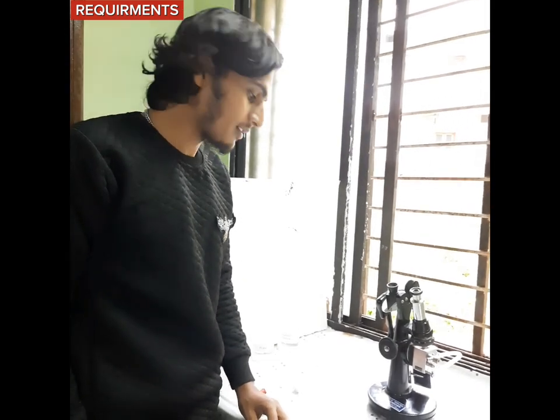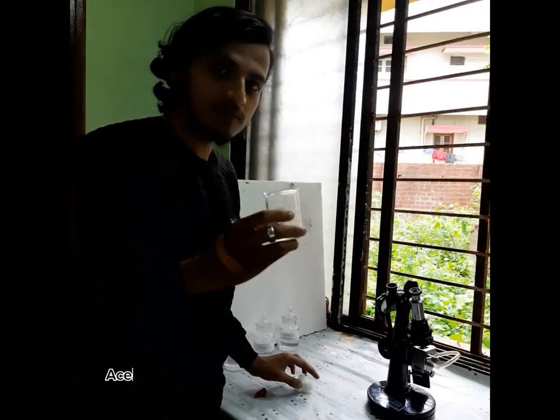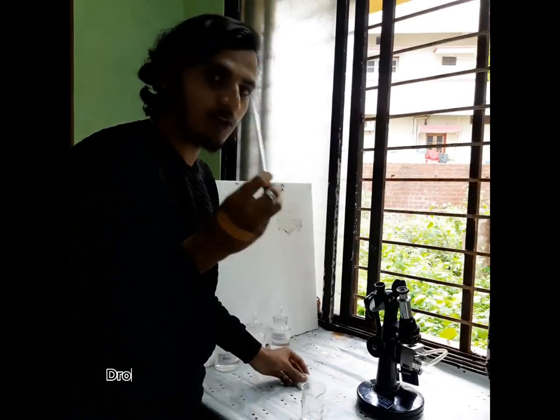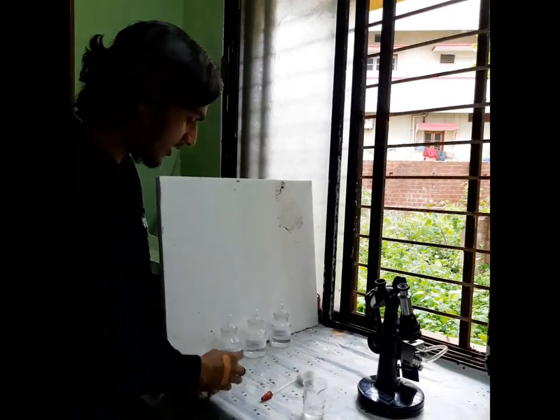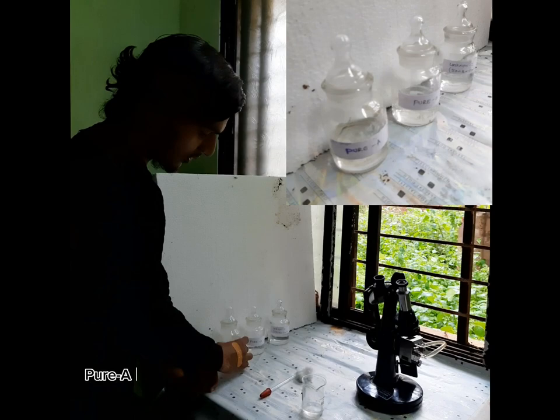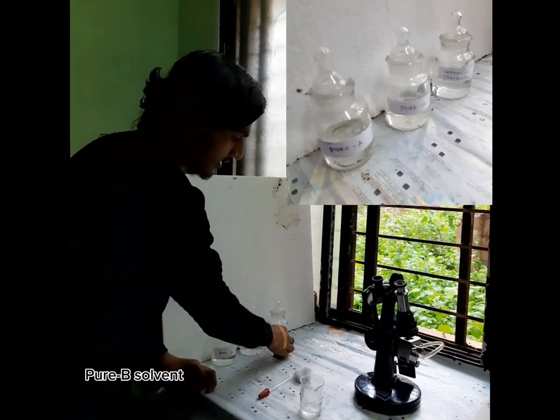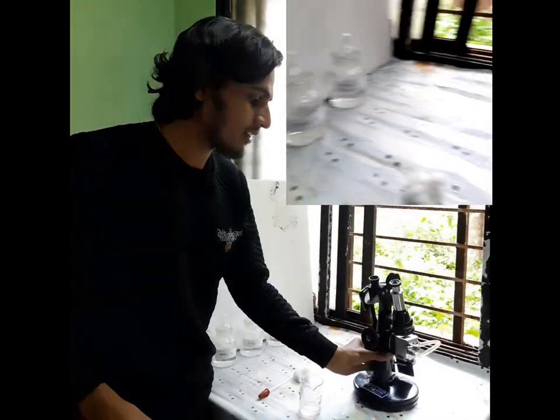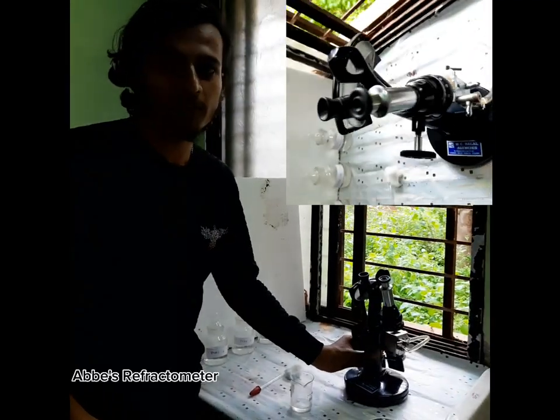For this experiment, we require acetone, cotton, and dropper, and also the chemical pure A solvent, pure B solvent, an unknown mixture, and the instrument Abbe refractometer.